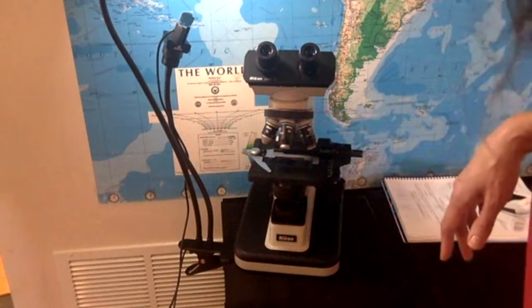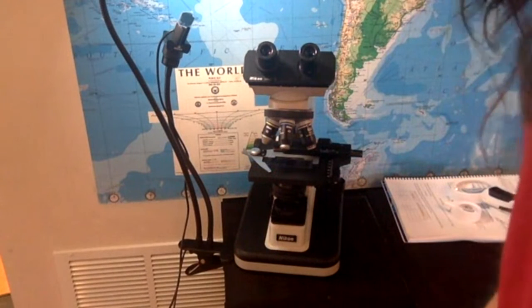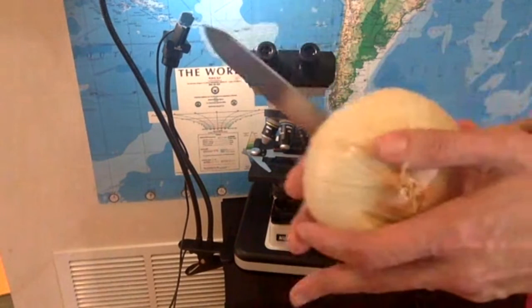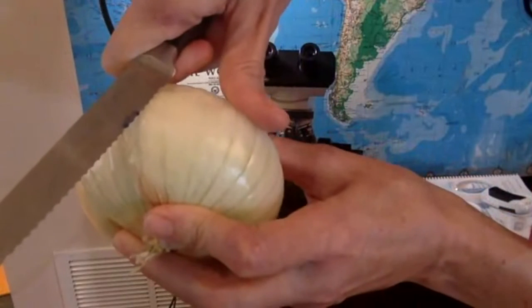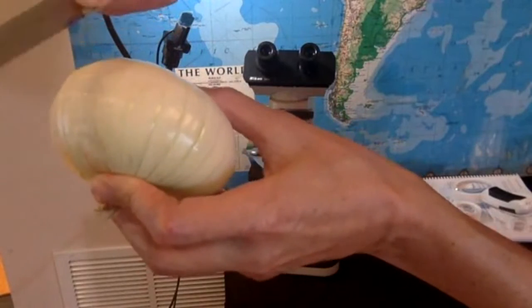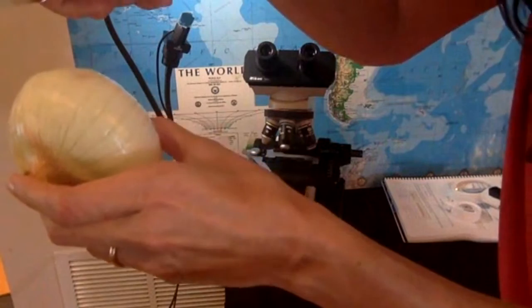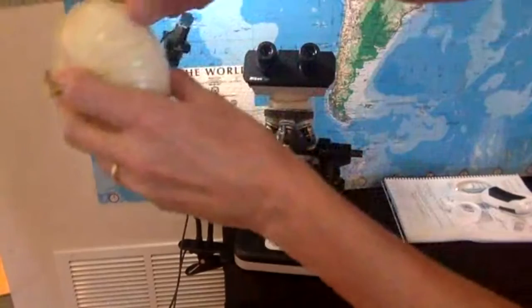All right, so I'm going to show you how you would make a sample of onion. Here we have onion, and I put a knife there, cut a little bit, hold that little piece of onion and pull. And when you pull, okay, this one didn't work. What you're hoping for is a little skin that will hang here. Right now, this is way too thick. The sample has to be see-through, otherwise it's not a good sample.